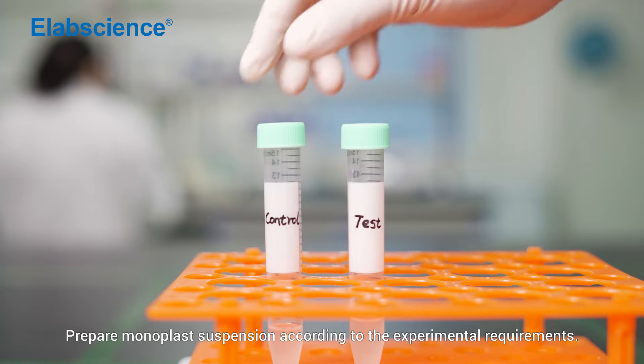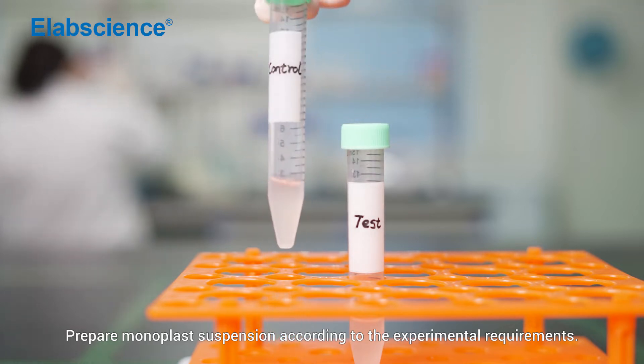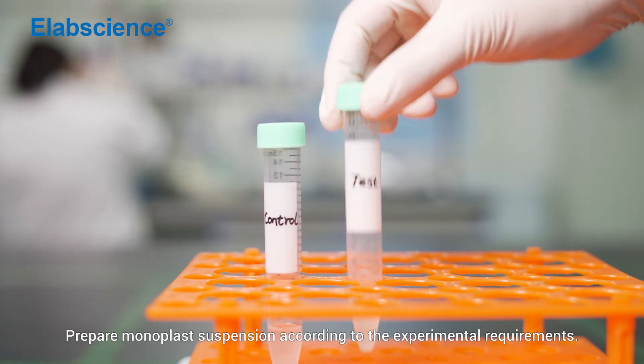Sample preparation. Prepare monoplast suspension according to the experimental requirements.